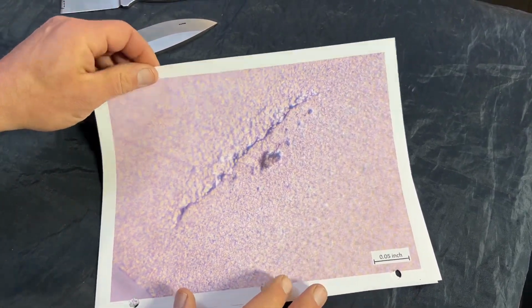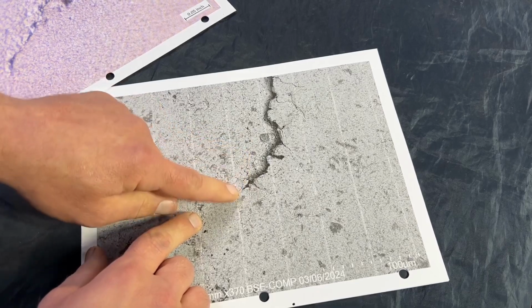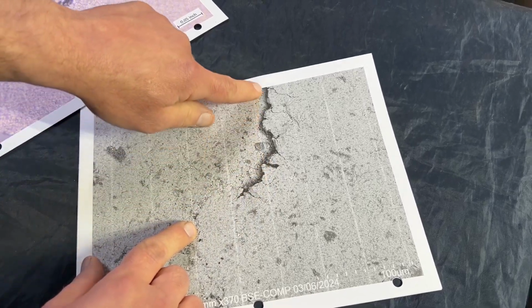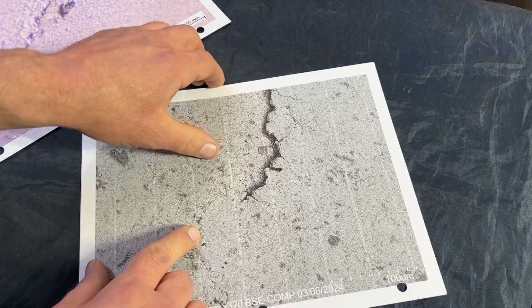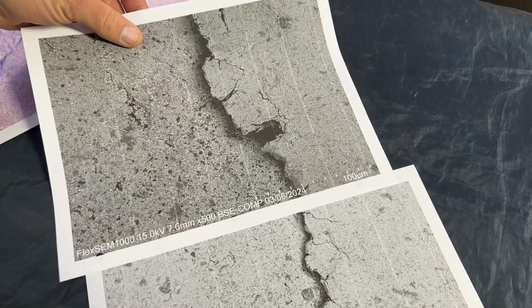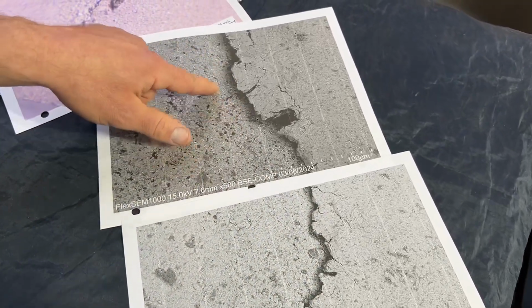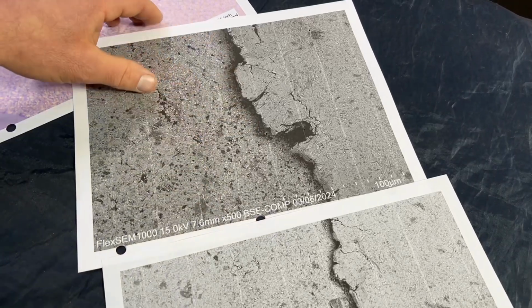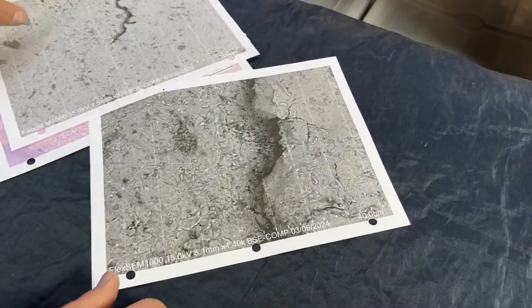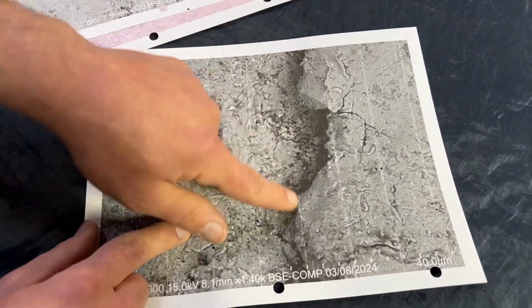As we come back in here closer, you can see we're at the edge of one of these delamination situations, which this sample had made it through to finishing. So whatever the soft material was here, it just delaminated and left this hard edge where it's just kind of crumbling right at the edge as the composition changes leading into whatever this is. And if you come across here, you can see that's basically what's going on across the surface there. That's images of different regions of that. And as you get into the middle of the anomaly, it's a bit thicker and deeper. So, that's very much not cracking as you get under the microscope there. And that's an even closer look at one of those areas where it's just like a ledge. And then again, the softer material left.